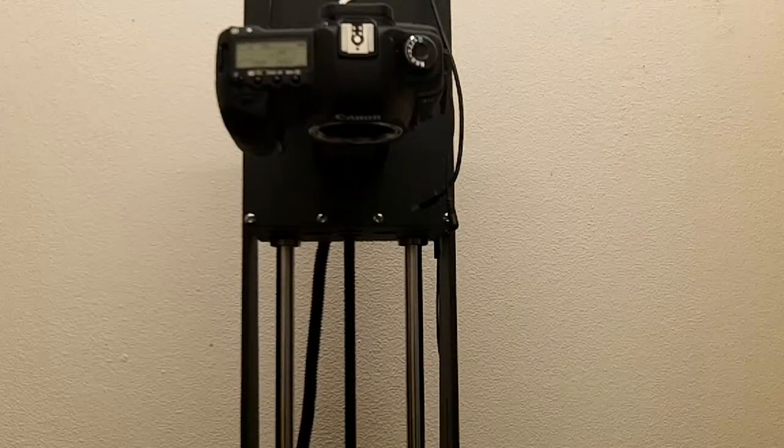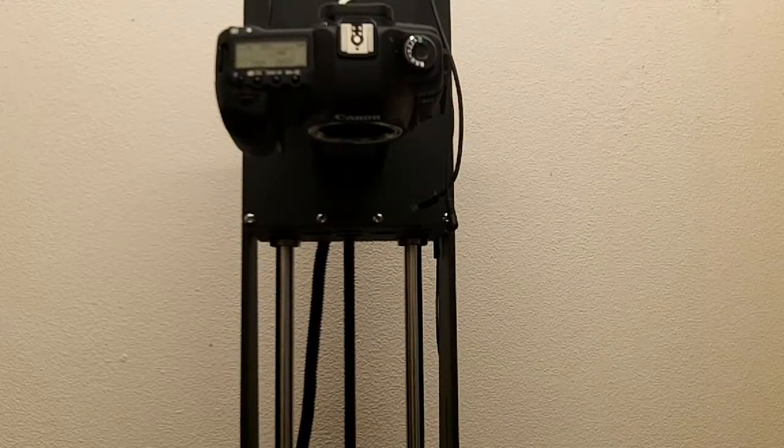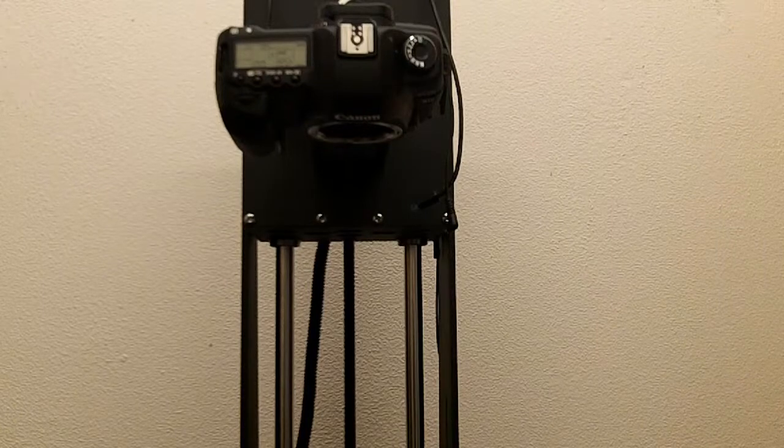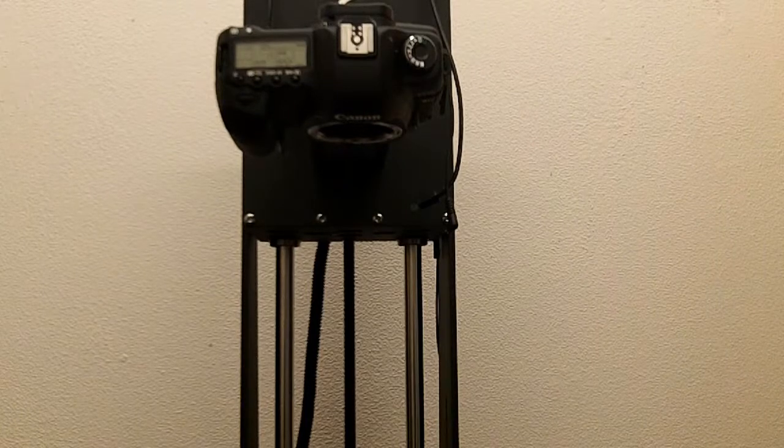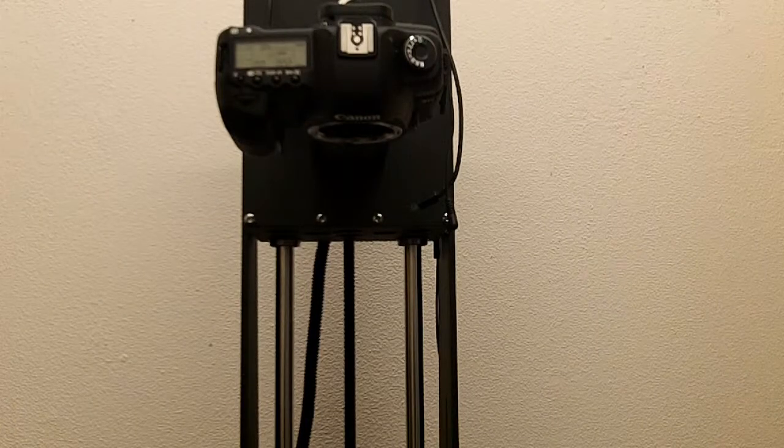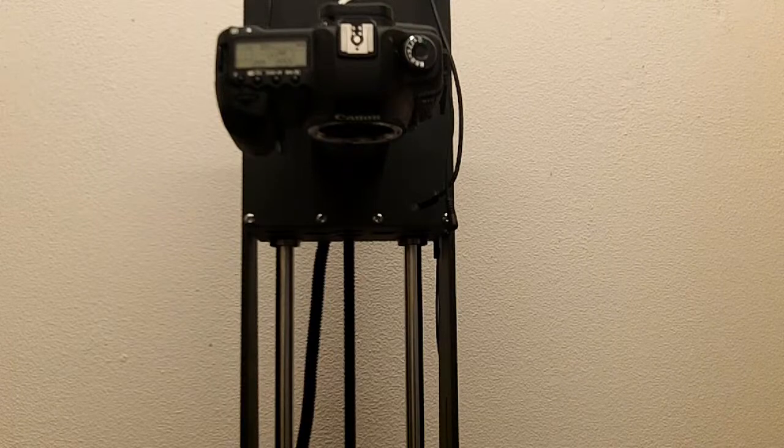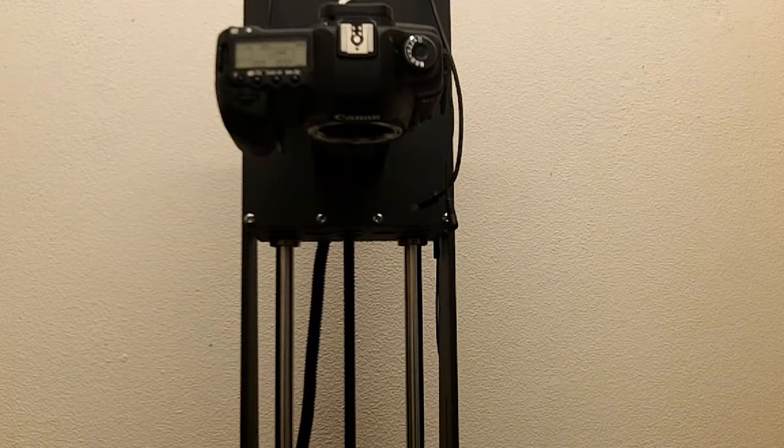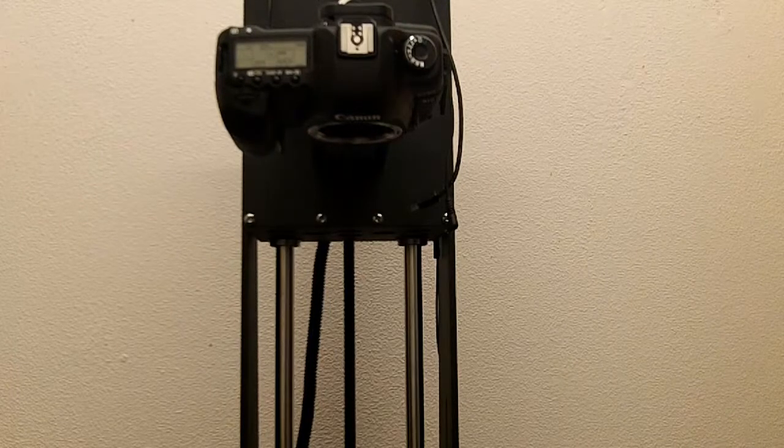In this video, I will show how to change the magnification for the various lenses, as well as some examples of specimens and appropriate lenses to use to image them based on their size.